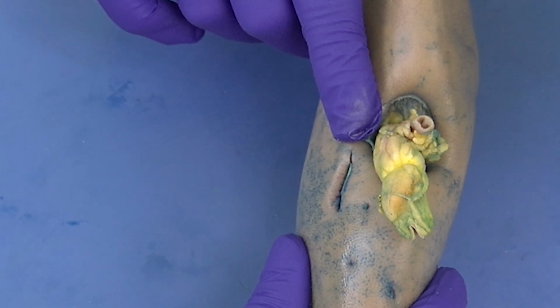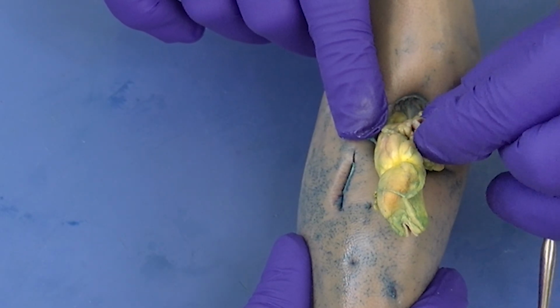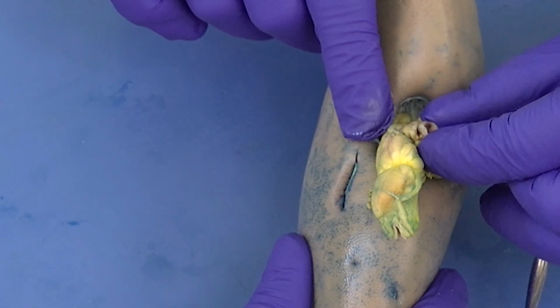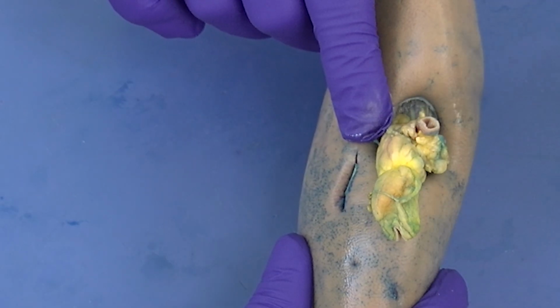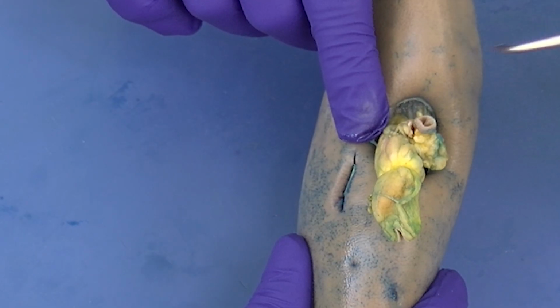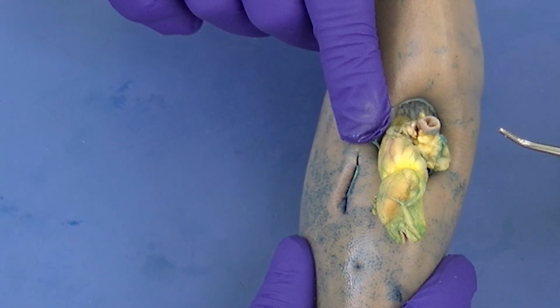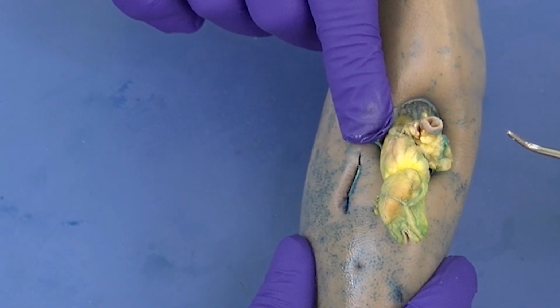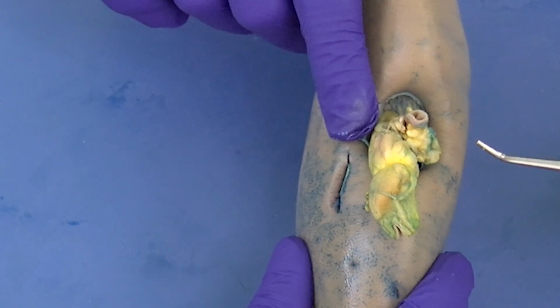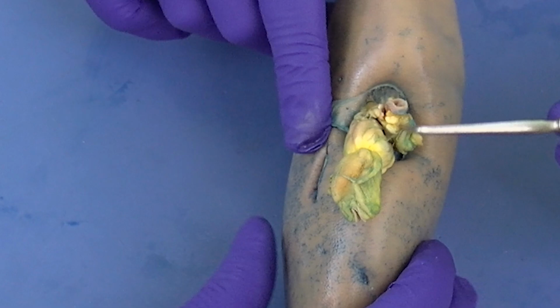You can recognize this because the artery, unlike veins, has a much thicker musculature. It has a lot more elasticity to it than what we see with the veins. And this is why it holds its shape even when it doesn't have fluid in it. So that's what we're looking at there. When we notice the vein in a moment, we're going to see that once there's no blood in that vein, it tends to collapse and go very flattened. And that's how you can tell the difference between the artery and the vein.